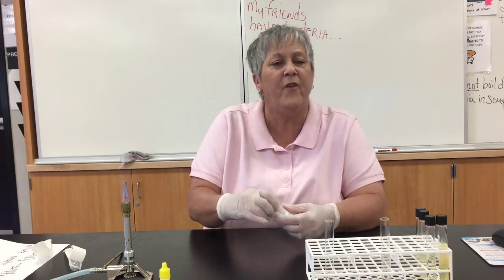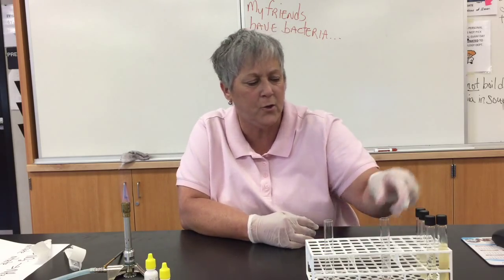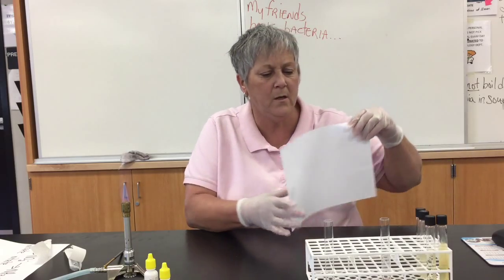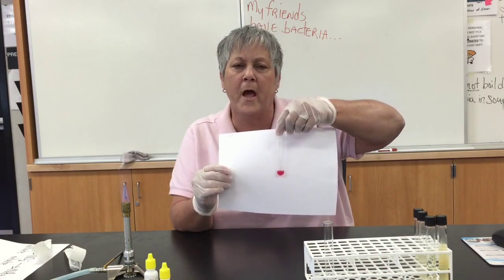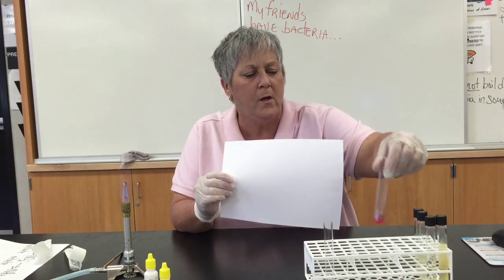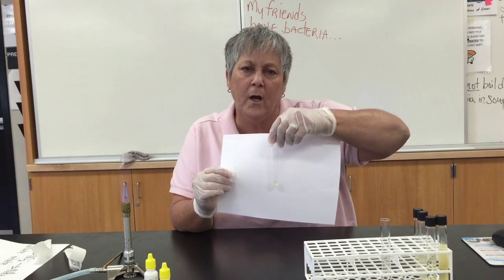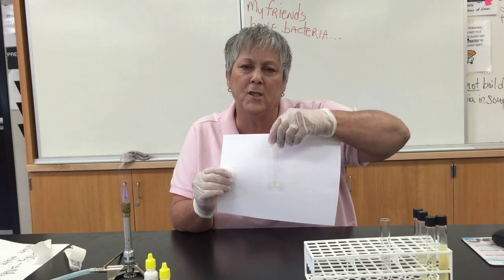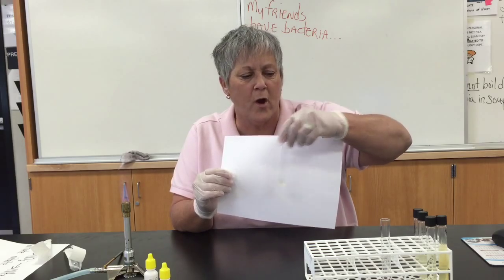The development of a red color indicates a positive reaction. If you take a look here, this is E. coli — got a nice positive cherry red color. So E. coli is positive for the production of nitrite. And here's my Acinetobacter — this organism is negative for the production of nitrite.